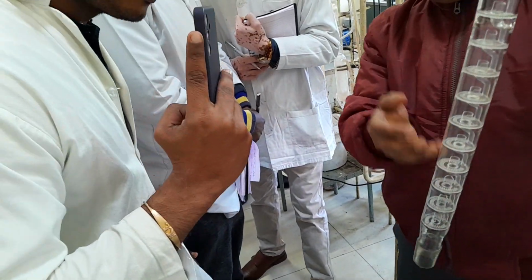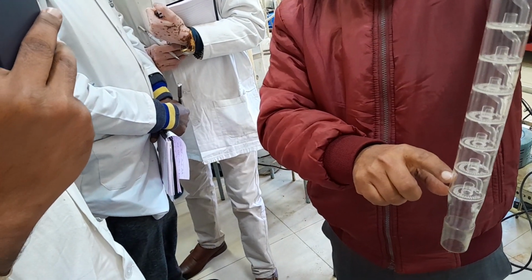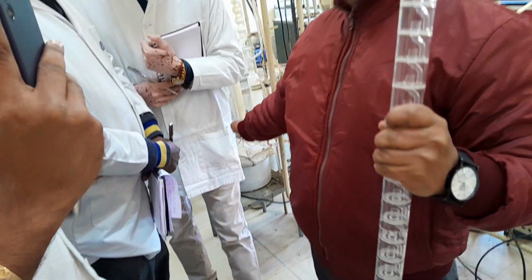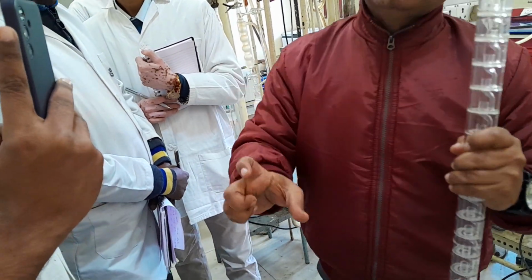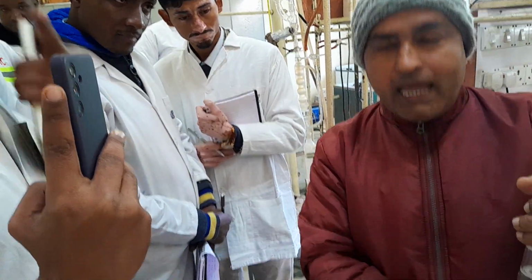Okay, once your liquid is filled up to this point and equilibrium has been generated, your heavier boiling point compound will go back into the flask. That you will see practically when I show you. So definitely that higher boiling compound will go down. In a similar fashion, again, between two plates there is another theoretical plate.